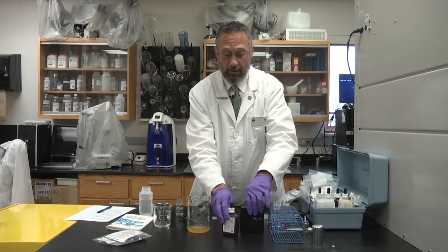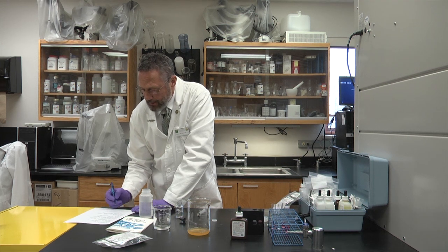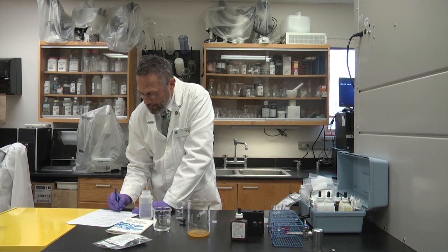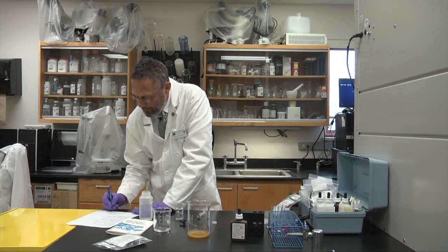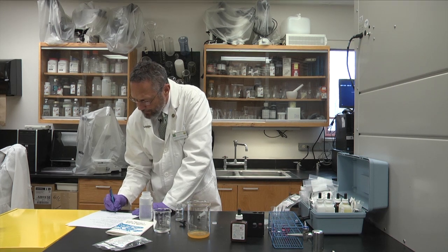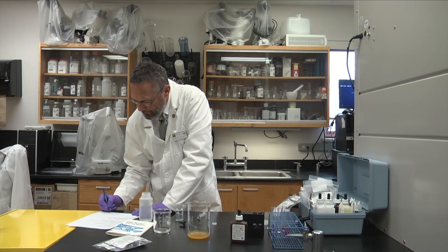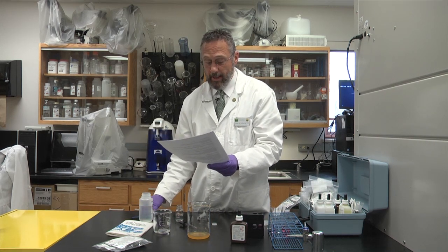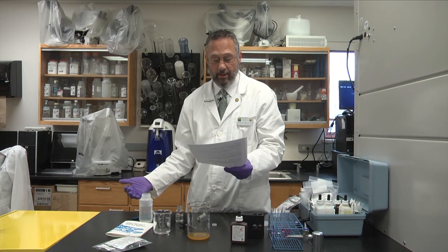And in order to be a little bit on the conservative side, we don't want to overestimate the amount of chloride. We want to add liberally with salt. So we take those seven drops and we subtract one. So we get six, six drops and we'll multiply that times the 3.8 factor for the chloride test. So 3.8 times six drops equals 22.8. So we'll just round that off to 23. So we have 23 milligrams per liter of chloride in this water. And so looking back at the nitrite that we got, we got a 2.3 parts per million nitrite. And we actually have 23 milligrams per liter of chloride. So in this case, we're actually protected adequately by the chloride that's in the water.